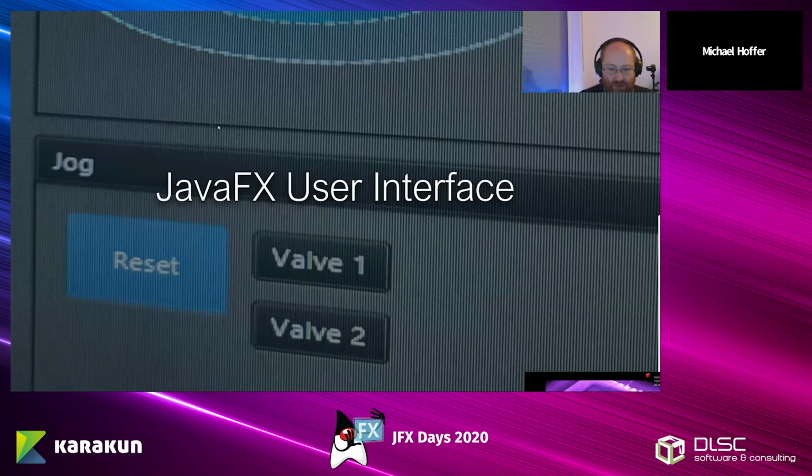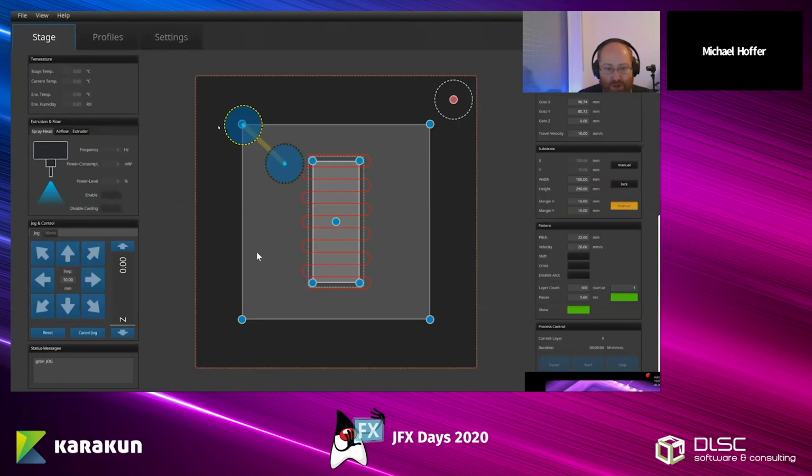Here you see the basic user interface. You can see this is a visualization of the printhead, and this is your finger. So let me just draw a finger. So this is your finger, and you are moving the head to a predefined location. You can snap to one of those other locations, like you could snap it here or in the center or somewhere else. And you see a table. So this here is the table or stage. This here is the substrate. And we have a purge location. And all of that is just real basic JavaFX. So I started with a prototype in a vector drawing application. And I just told JavaFX, hey, this is a circle. And I supplied it with some CSS. We can also look at the source code if you want.